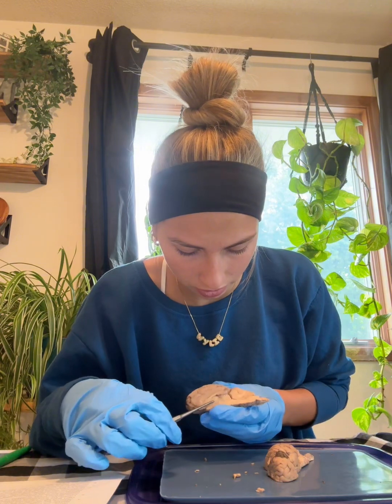The diencephalon region is made up of the thalamus and the hypothalamus. That's located right in here. That's a region. The thalamus is located right here. It's superior to the hypothalamus. It's a sensory relay center. Sensory impulses enter, and the impulses are sent out to the appropriate cerebral region.